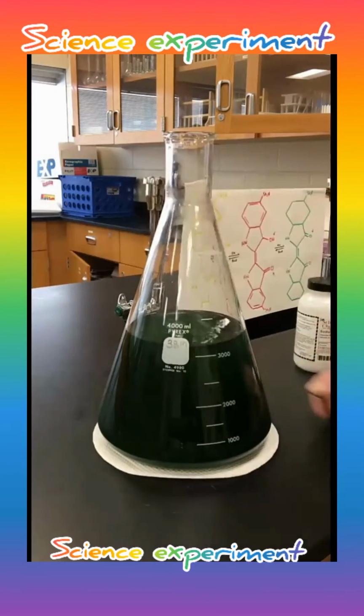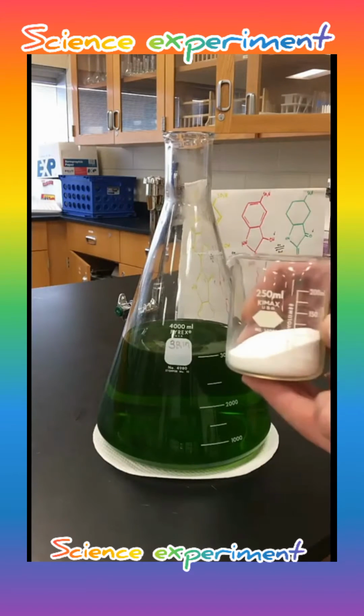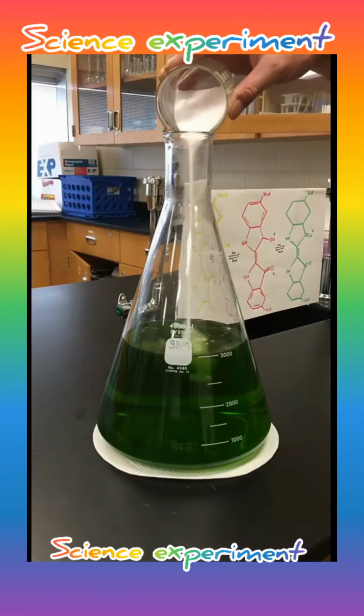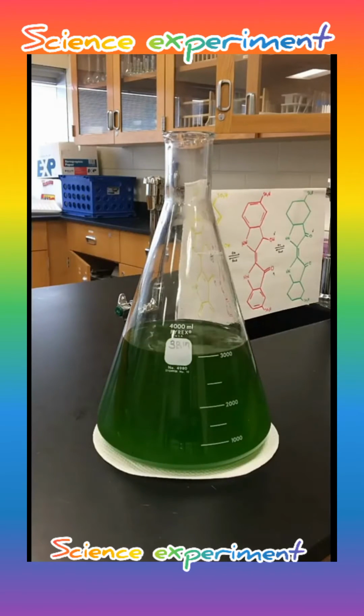The next thing we're going to add to our flask is going to be some sugar. It has to be glucose or dextrose or reducing sugar. It can't just be regular table sugar. This creates what's known as a reversible oxidation-reduction reaction.